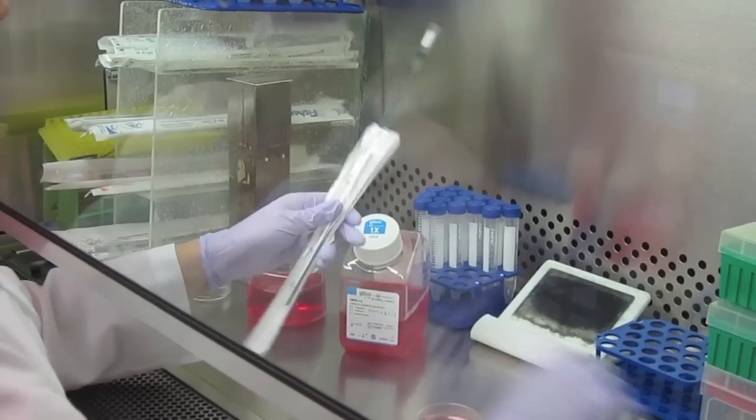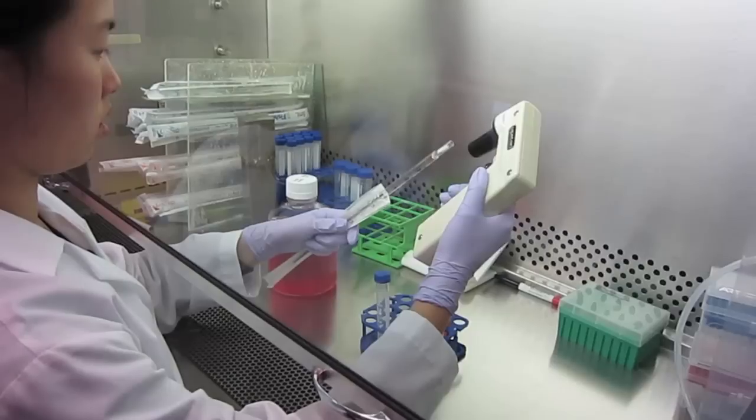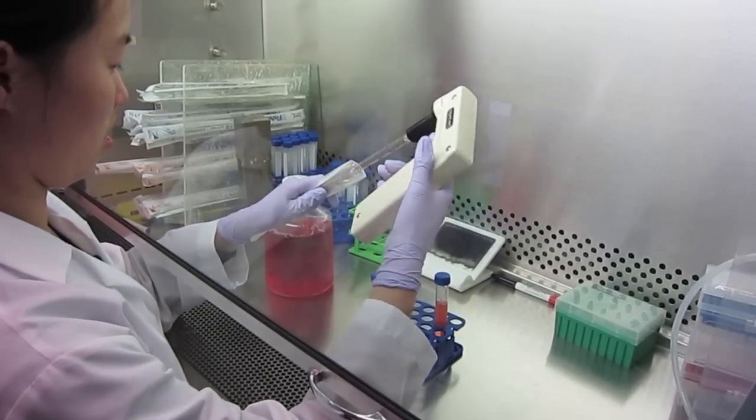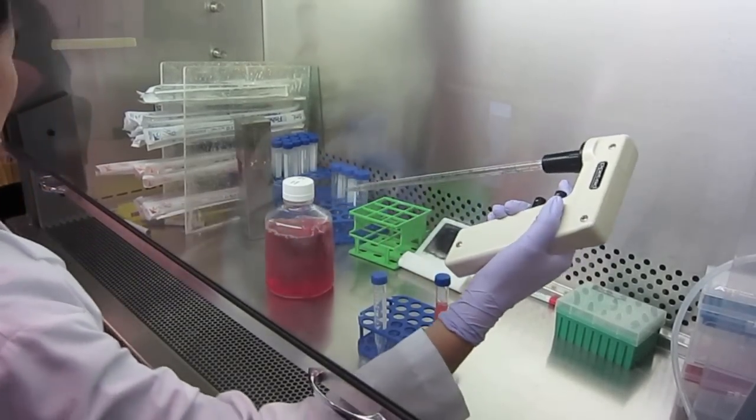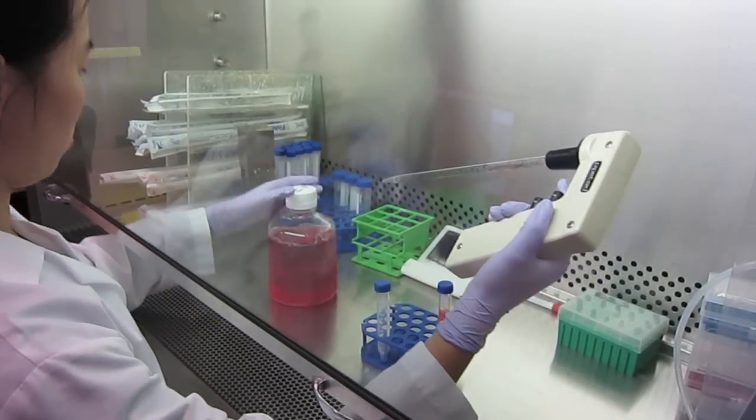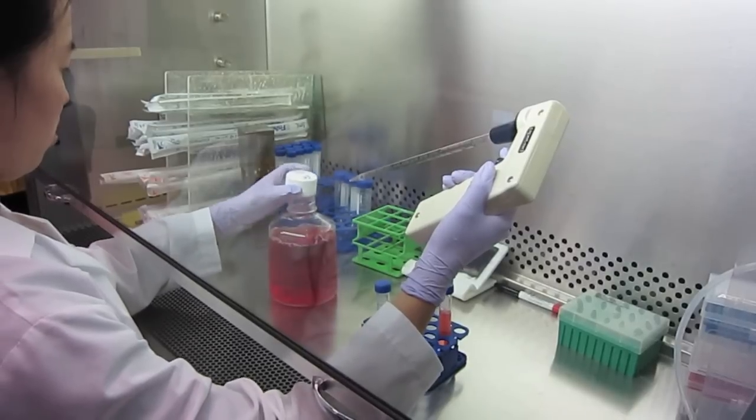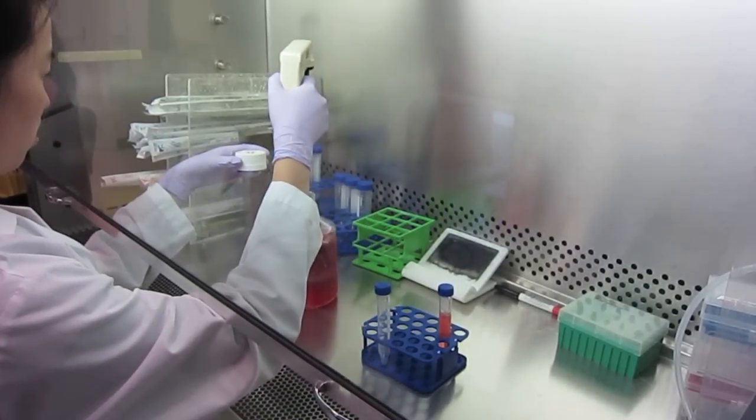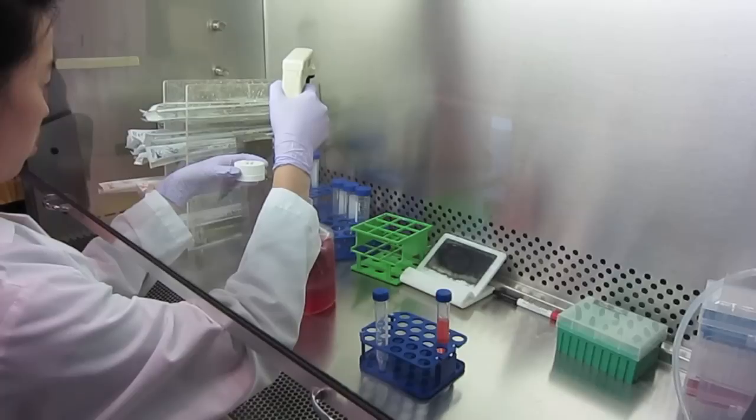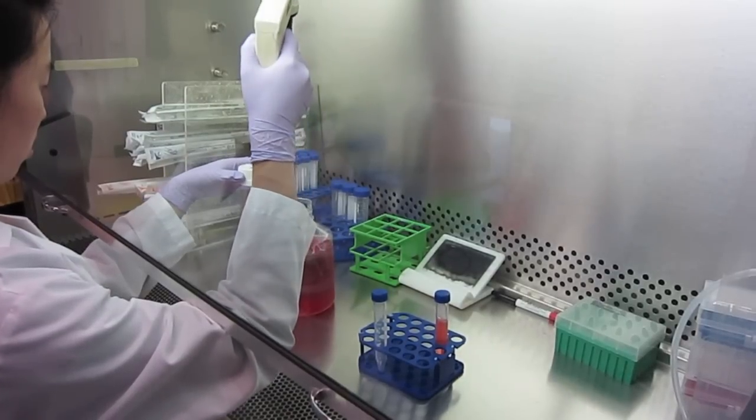Hold down the loose flaps of the wrapper to eliminate risk of the tip touching the outside of the wrapper. Place the pipet in the automated pipetter and turn the pipet to indicate the units of measurement you would like to see. It is important not to touch the tip of the pipet to anything not sterile. Dispose of all used pipet tips in the biosafety container.